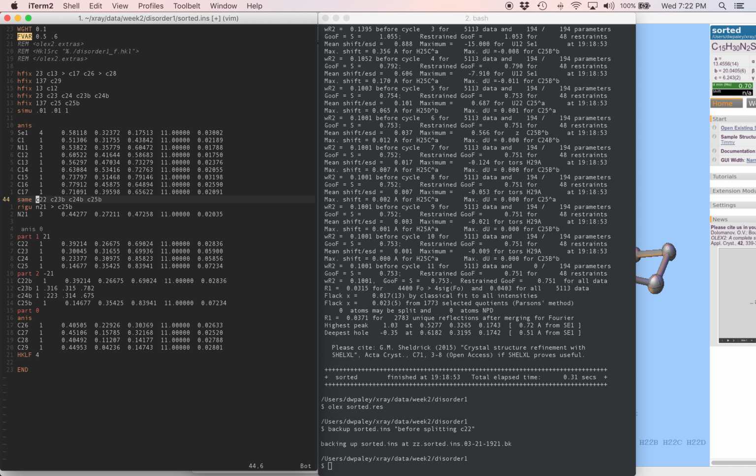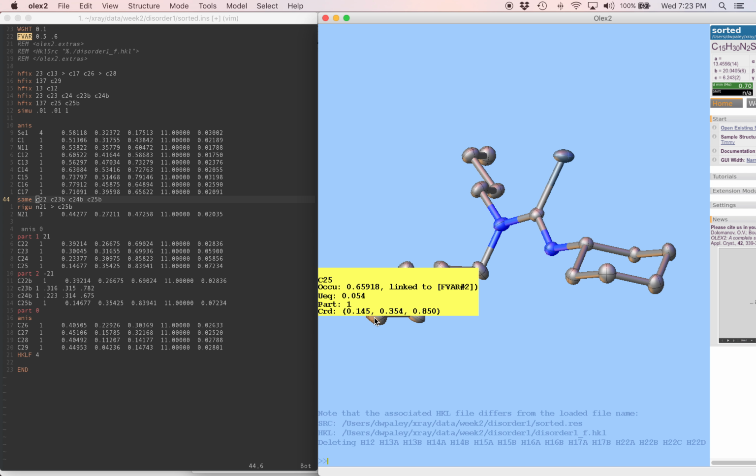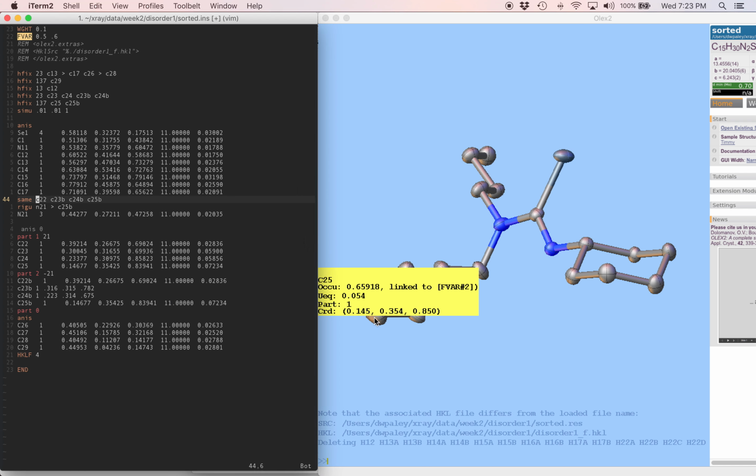So now what are we making the same? We have one position of this chain consisting of C22, 23, 24, 25, and nitrogen 21, the last ordered atom that it's attached to. The second position is nitrogen 21, C22b, which we're creating now, and 23, 24, 25b. So the 5 atoms following the same instruction are N21 through C25, and the atoms that we want to match them to are N21, C22b through C25b.